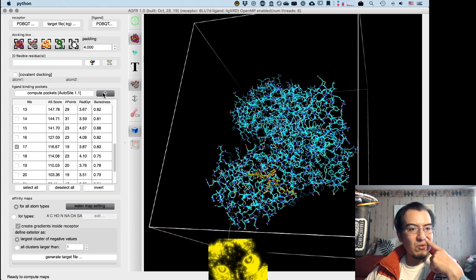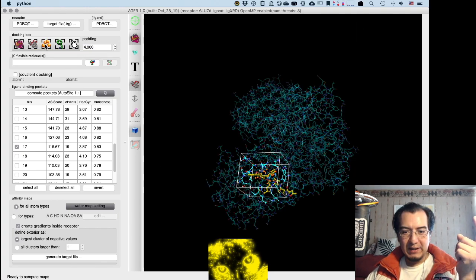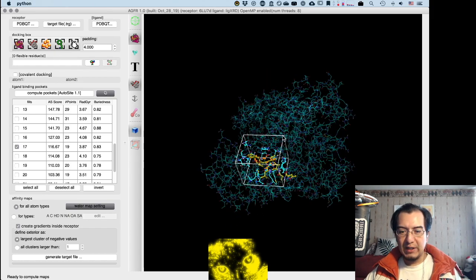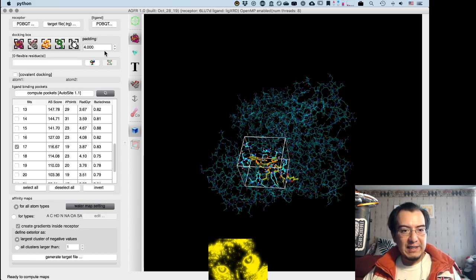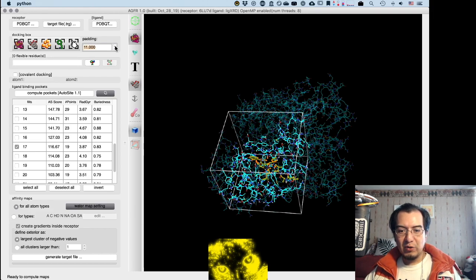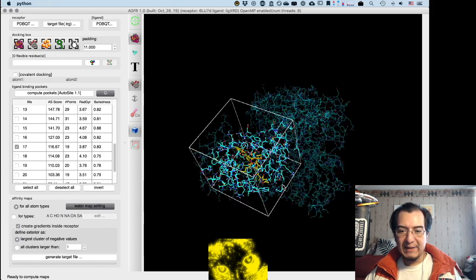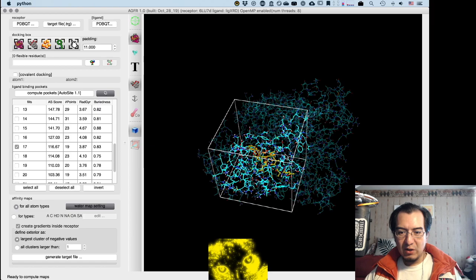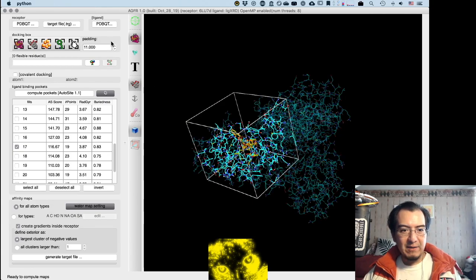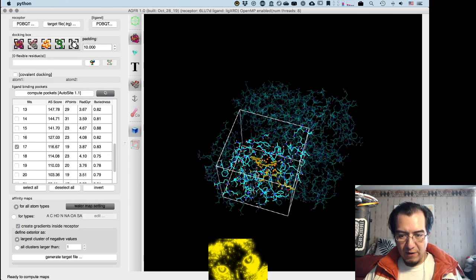Yeah, this is the part that I was confused about, how to make, yes, this one, sorry, box all ligand binding pockets. There, that is a step I missed. Now, as it is, this box is really way too small for the very same ligand I'm using to find the binding site. So this setting of the padding is going to be an important one, because this can increase that box so that this ligand and other bigger ligands fit. As you can see, padding here is crucial, otherwise the box will be too tiny and the search is going to be insufficient. I think that 10 is probably enough.